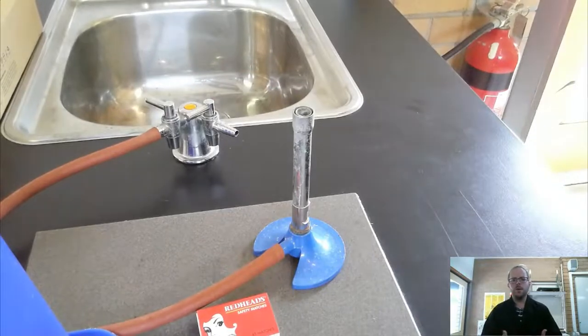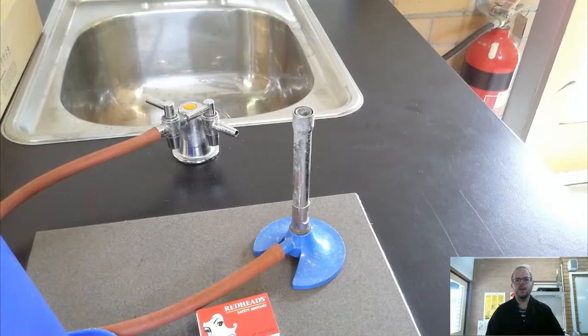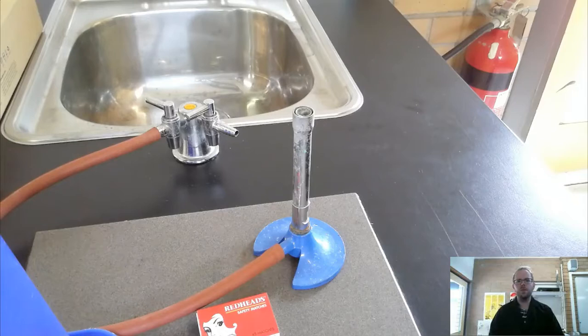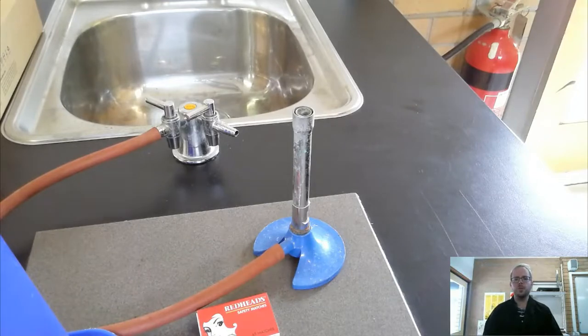A couple of things to start with. First of all, safety is the most important thing here. Bunsen burner is a tool that we use all the time to help us to heat things and to carry out chemical reactions and all sorts of processes in science, but it's very important that we can use one safely, effectively, and efficiently.